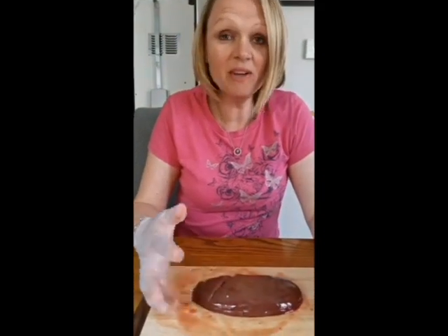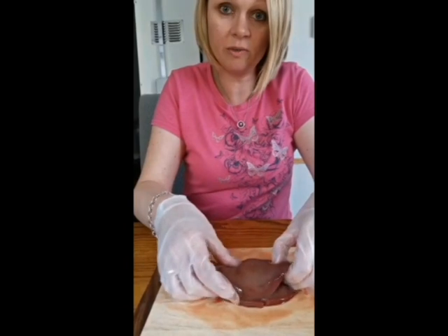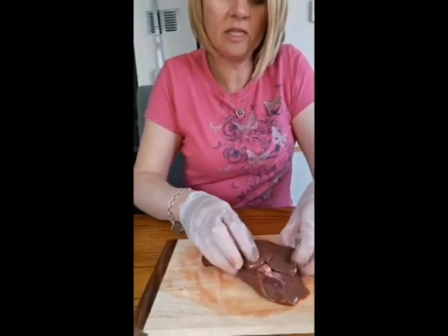Okay, so I've cut it open. It's a bit stinky, it definitely smells different compared to the heart, but it's got a different job as well, and this one does clean the blood and make the urine. So I've cut it open, and I'm going to open it up to show you what's inside. I said this was the ureter here, okay, that feeds to the bladder.